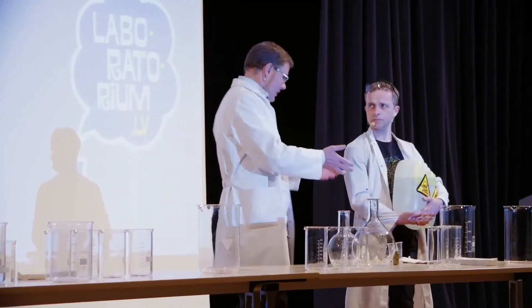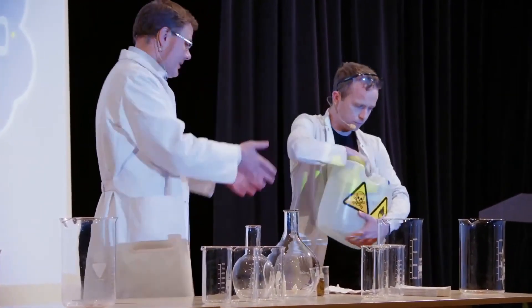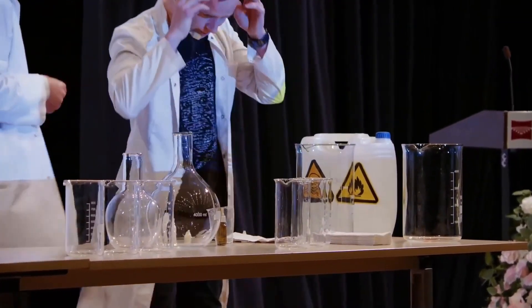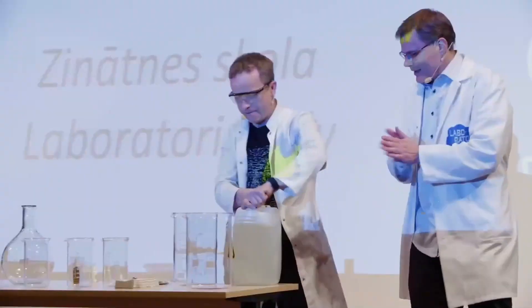I know you are so smart, so we thought about what we could bring here, and we decided: let's take some very simple chemical puzzles. I think you will like them. Let's start with the first one. For this puzzle, we need just one liquid — one specific liquid.